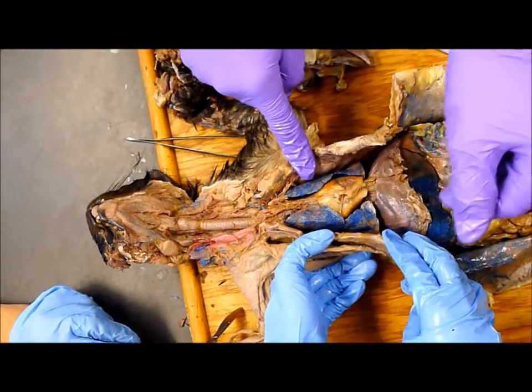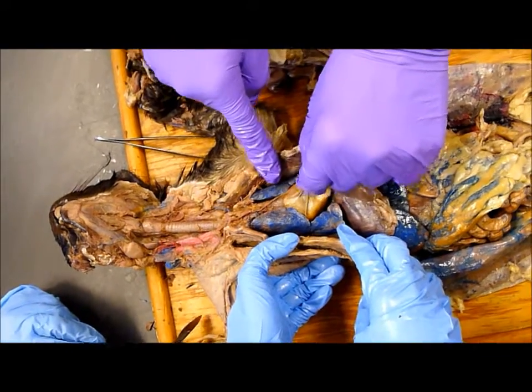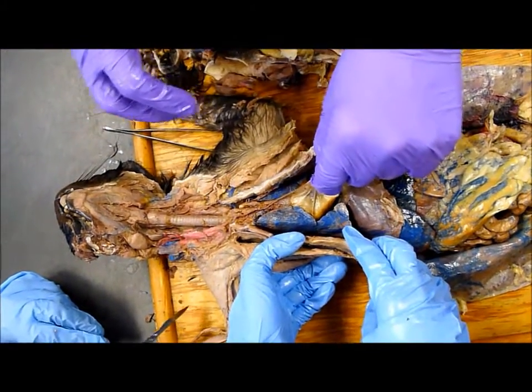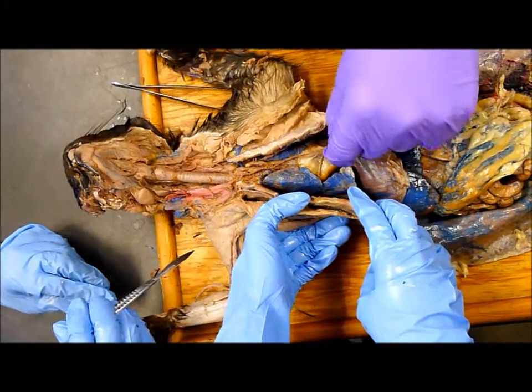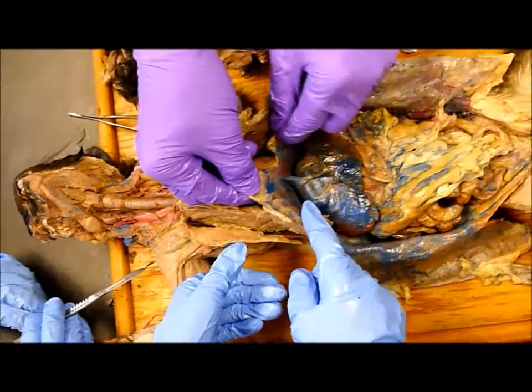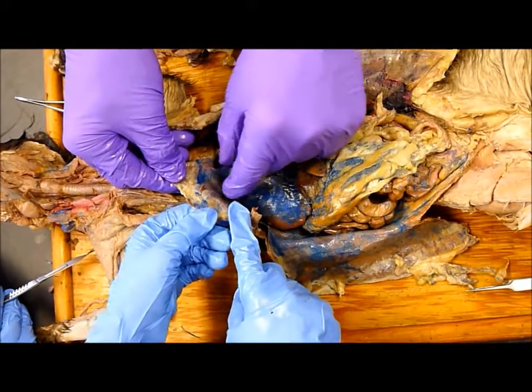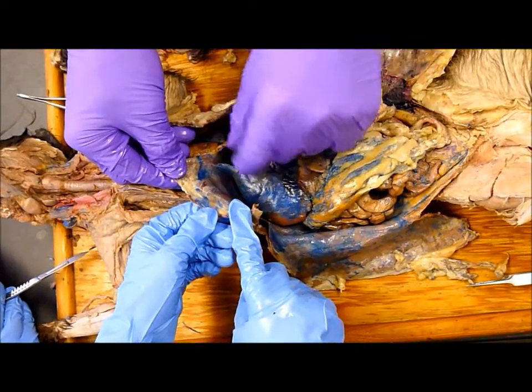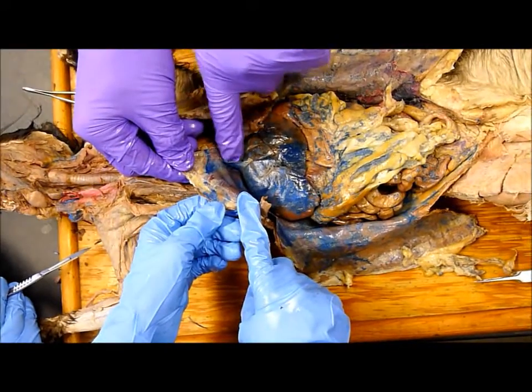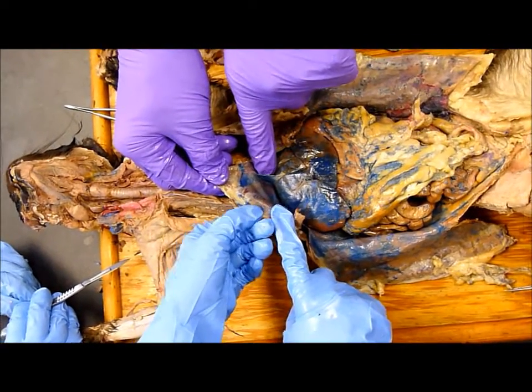And if you cut through that — the mediastinum — that's the space. The heart and its own pericardial sac is inside that space. Between the liver and the diaphragm, that's the falciform ligament. The falciform ligament is one of the only ventral mesenteries left.